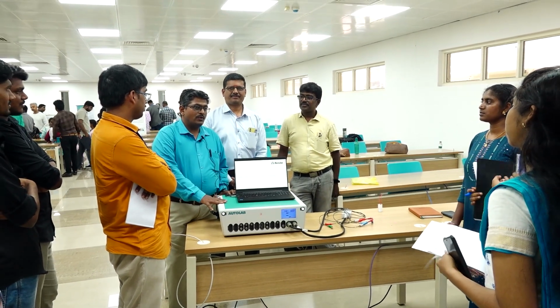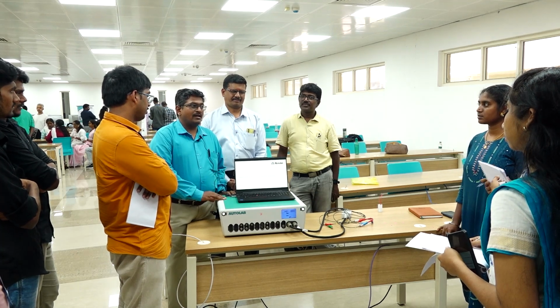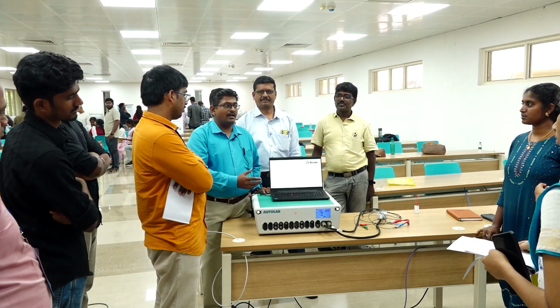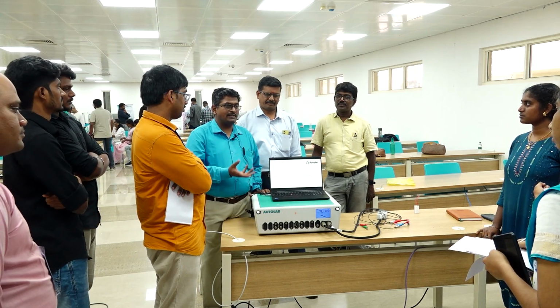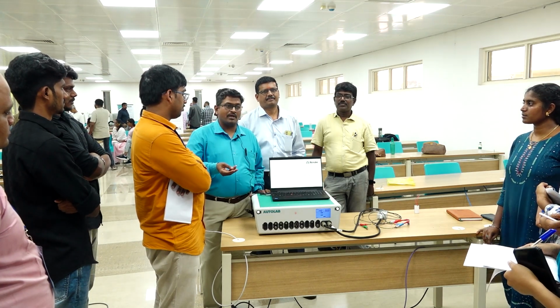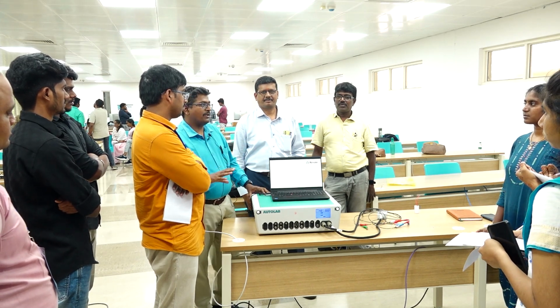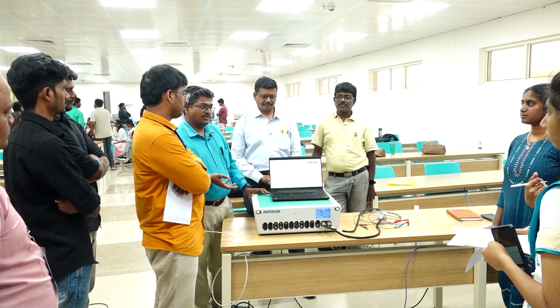Today we are going to explore more options of the electrochemical workstation and how it is used in the area of battery and corrosion. We have set up 3 different practical sessions today to concentrate more on batteries and the basics of the electrochemical workstation. In any electrochemical research, we will be doing CV, cyclic voltammetry, and EIS, electrochemical impedance, and then we will be doing charge discharge. These three sessions are planned to give the basic idea about the electrochemical workstation, what it does, what kind of information it gives, and how it is useful for your research.